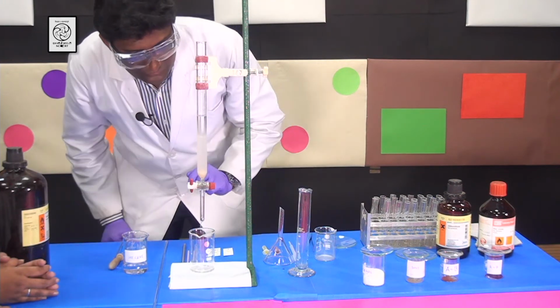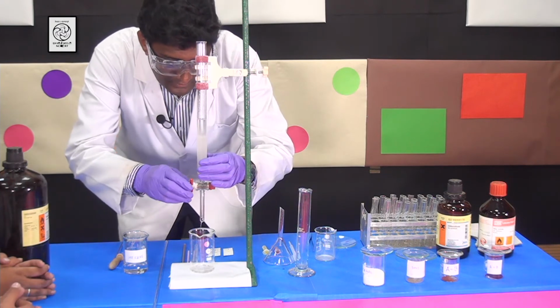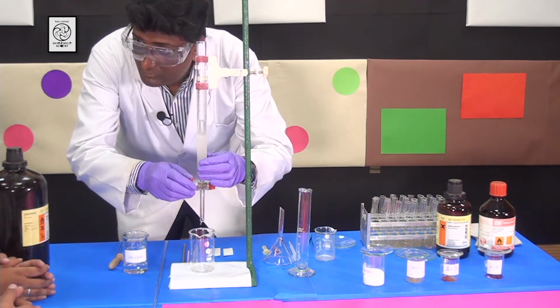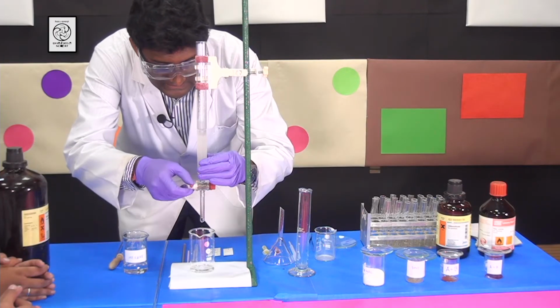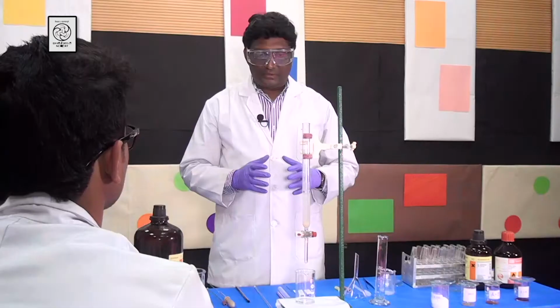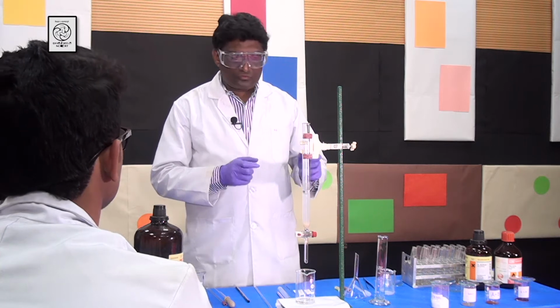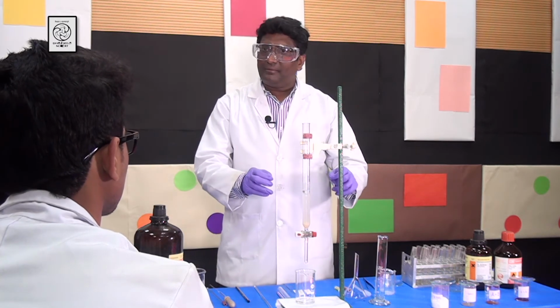very gently so that the extra solvent which is on the top is going to come down slowly. Then the silica gel is settled down nicely. There is some solvent on the top of the silica gel. Make about 3 to 4 inches height of silica gel so that the compounds can be separated properly.